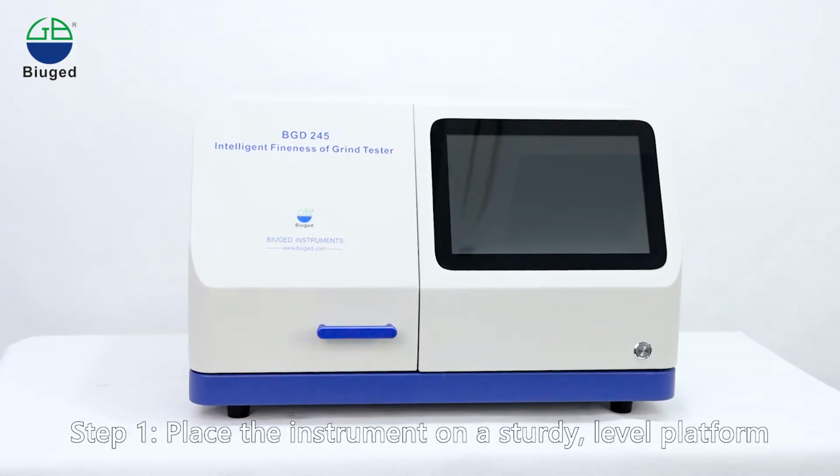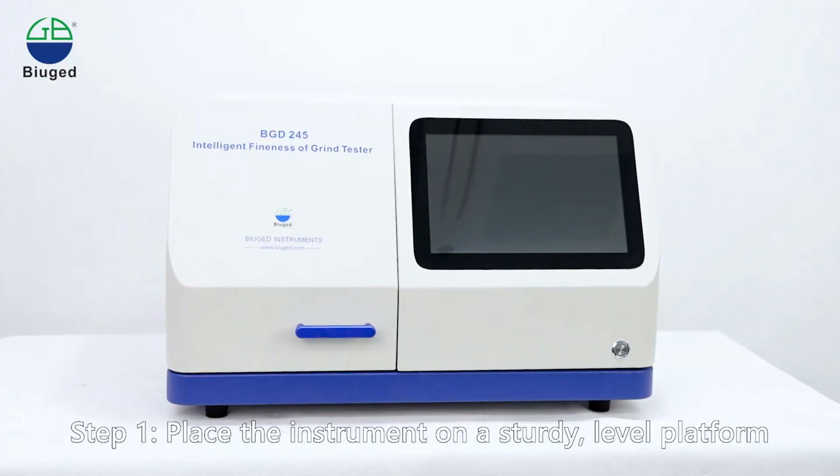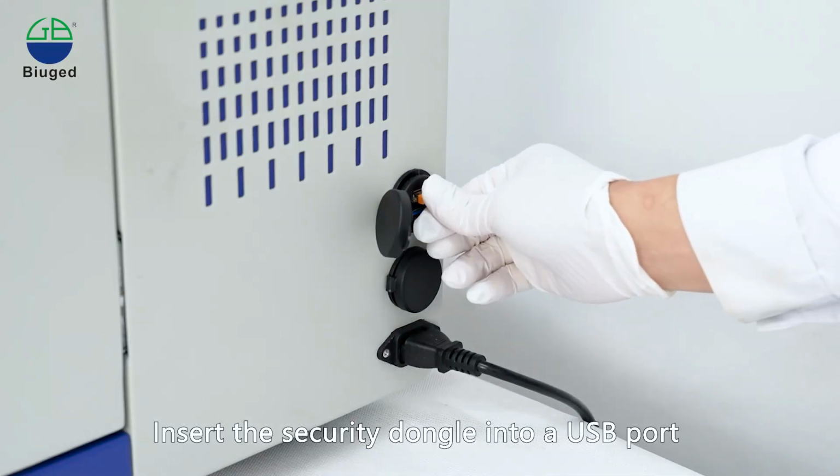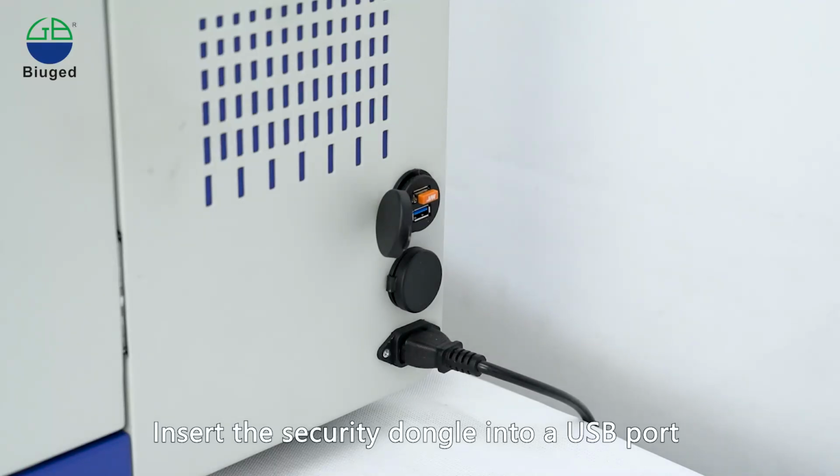Step 1. Place the instrument on a sturdy, level platform. Step 2. Connect cables and power on. Connect the power cable, and insert the security dongle into a USB port.